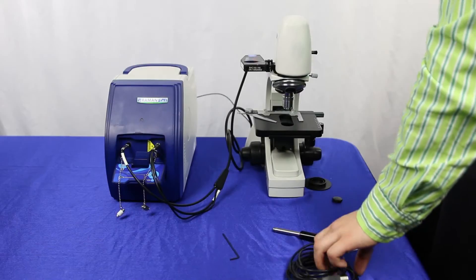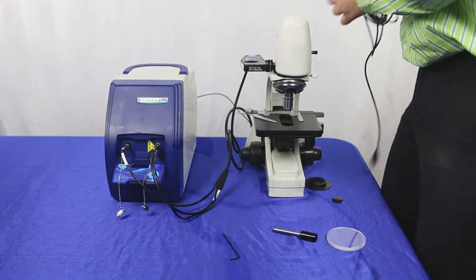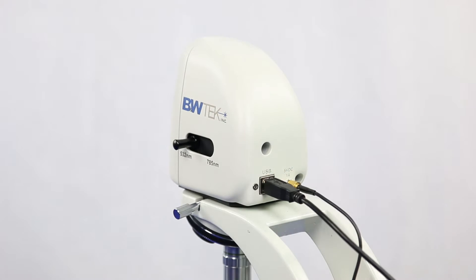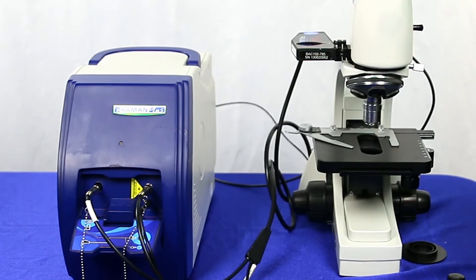The last thing you'll want to do is also attach your USB cable to the back of the microscope, and then you would take that and attach it to your computer once you're ready to set that up.